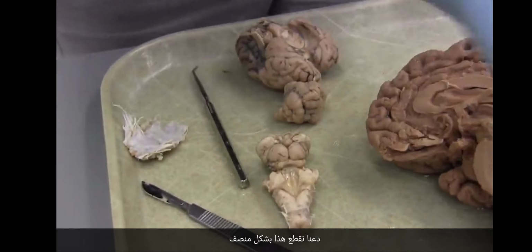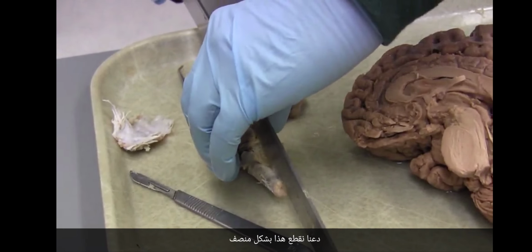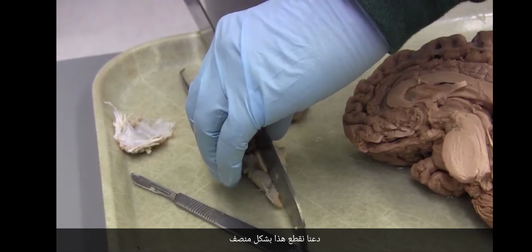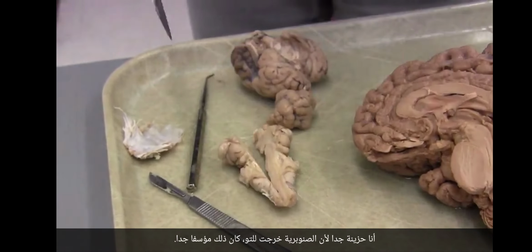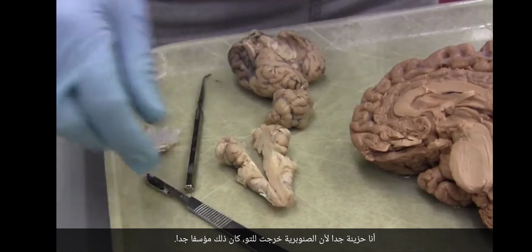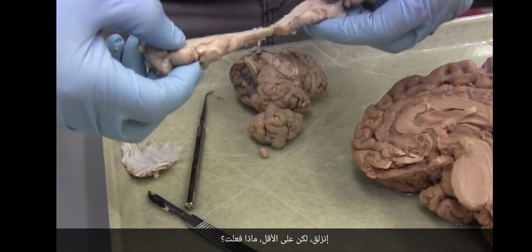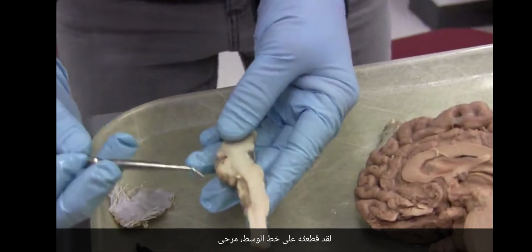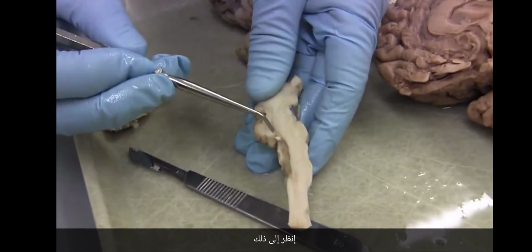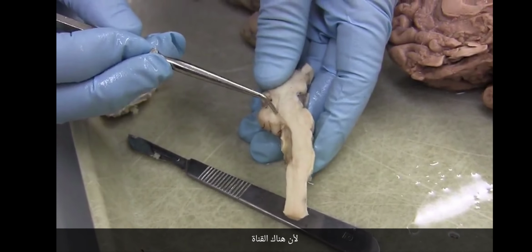Let's cut this mid-sagittally. I'm so sad because the pineal just came off. That was very unfortunate. It slipped off, but at the very least, what did I do? I cut it right on midline. Yay! Look at that. How do I know? Because there is the aqueduct. You see how that leads?